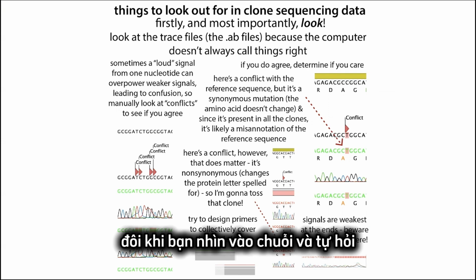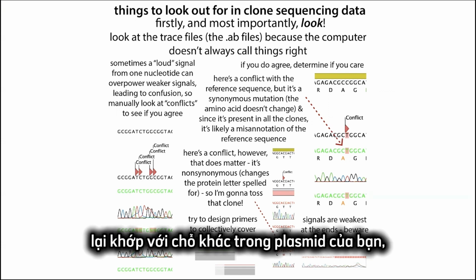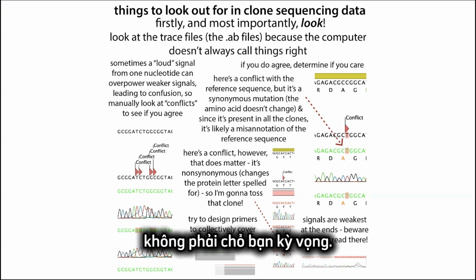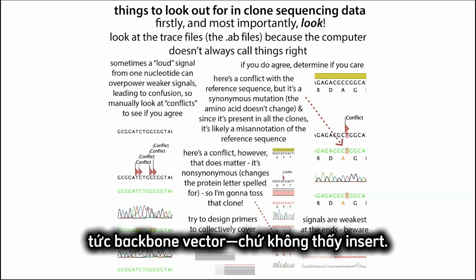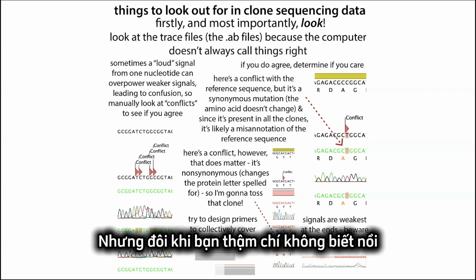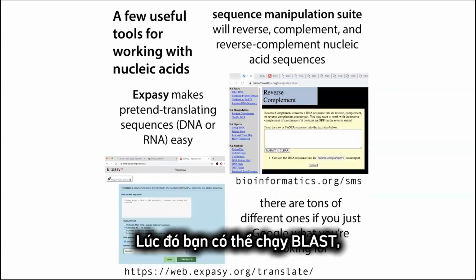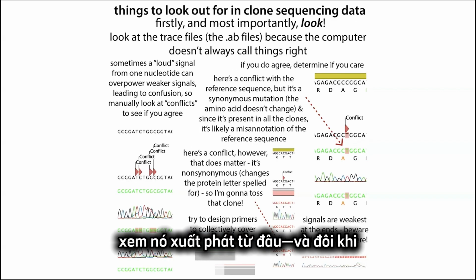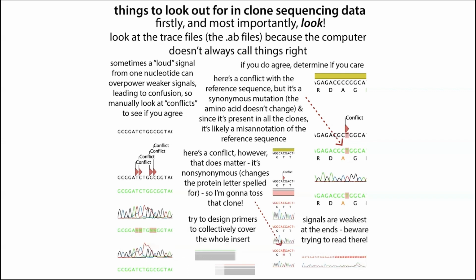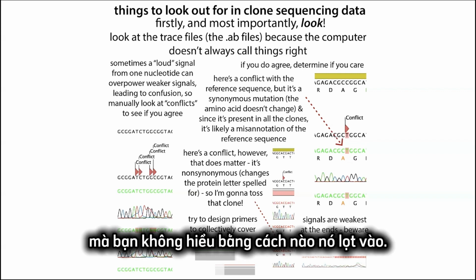Sometimes you're like, where the heck does this come from? It's not matching any place in my plasmid. Sometimes you might see a sequence that matches elsewhere in your plasmid, not where you were expecting. You might see just the vector instead of your insert in there. But sometimes you can't even figure out where this sequence came from. Then you can do BLAST and look up the sequence to see where it came from. Sometimes you might find that it's something your lab mate was working on, or it's just some really random thing that you have no clue how it got there.